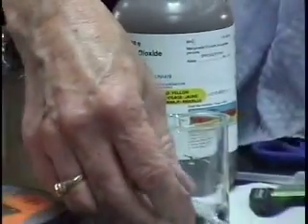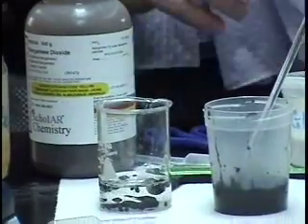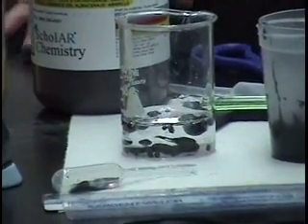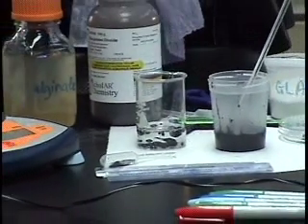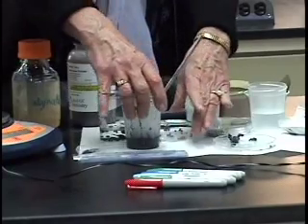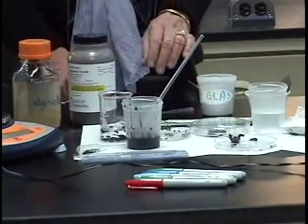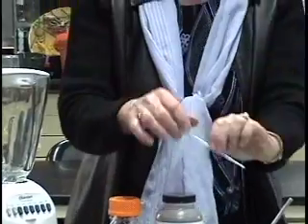And after they create spheres and cylinders and other shapes, then I would invite the students to see if they could actually make spheres of a particular size. Spheres that are either really big, and make 10 of them. The challenge is to make 10 of them that are approximately the same size. And so they would pretty quickly figure out how to make different shapes, and using droppers, cutting the dropper in different ways, you can get different sizes of spheres.